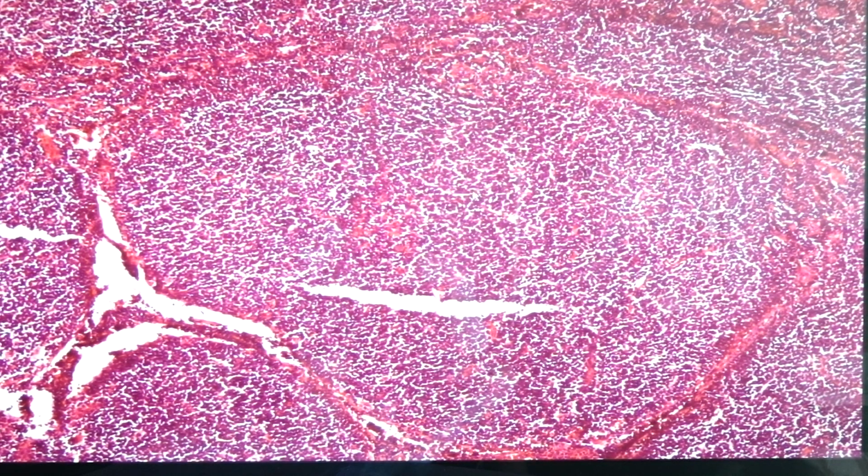It means that the cells present within the germinal center would be similar to the cells that we would see on the outermost region, the mantle zone. So they are all the same. You do not see the light and dark zones that we saw in the reactive hyperplasia of the tonsil. Those are the most important differentiating features.